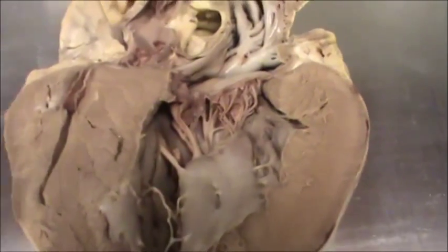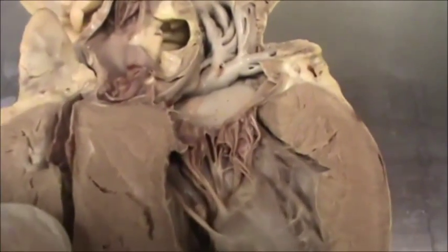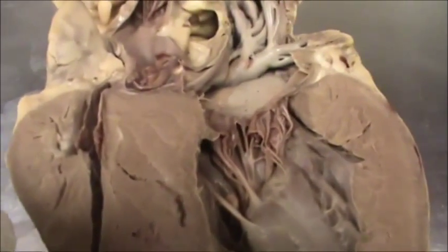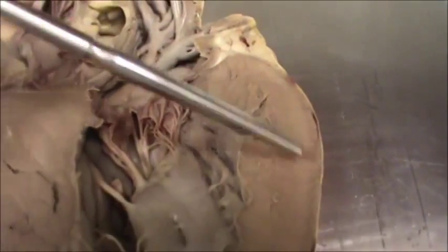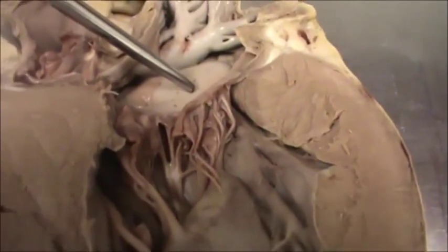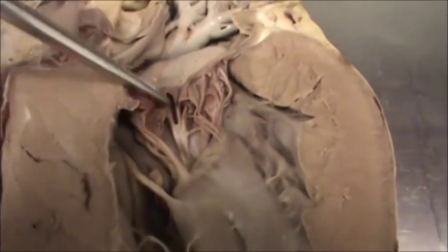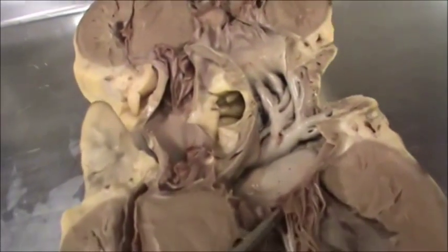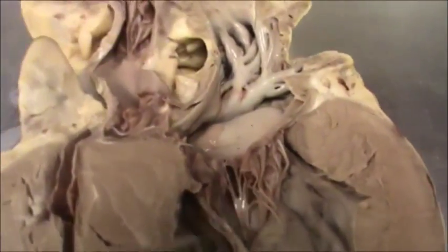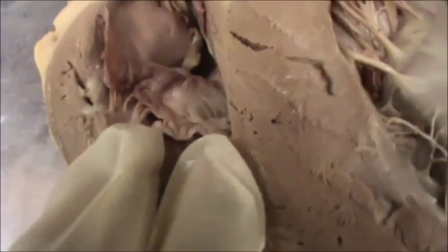Now we look into the valves separating the atrium and ventricle. On the left side, the valve separating the left atrium and left ventricle is called the bicuspid or mitral valve. The valve separating the right atrium and right ventricle is called the tricuspid valve.